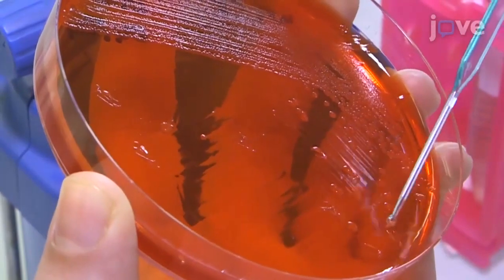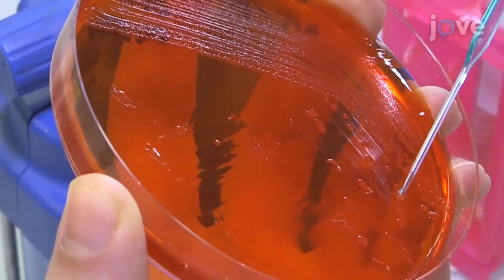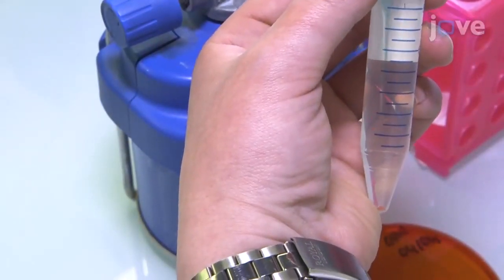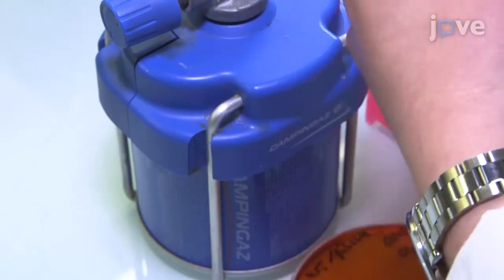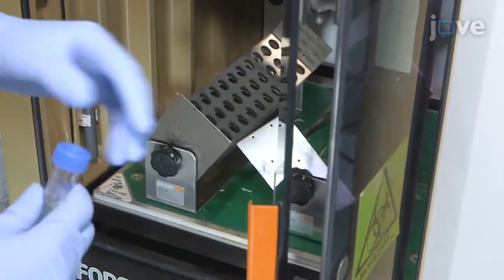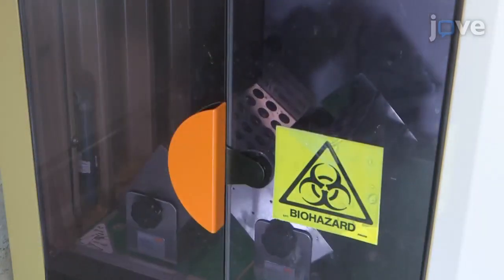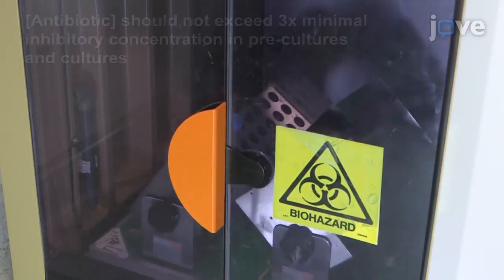Prepare pre-cultures from the streaked plates by picking three red colonies and inoculating TCS broth with 75 micrograms per milliliter of ampicillin. Grow the liquid cultures in a shaking incubator at 37 degrees Celsius and 200 RPM for 16 hours.